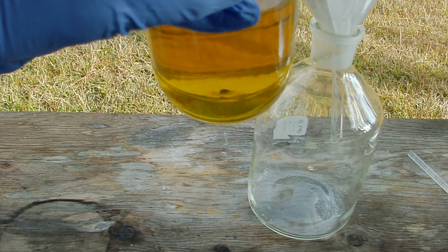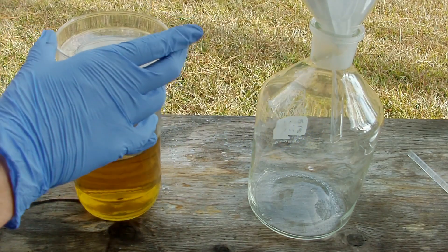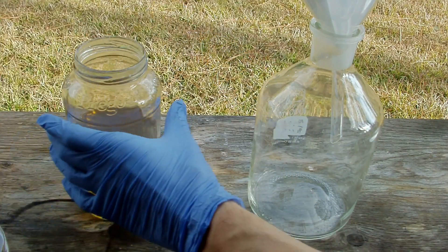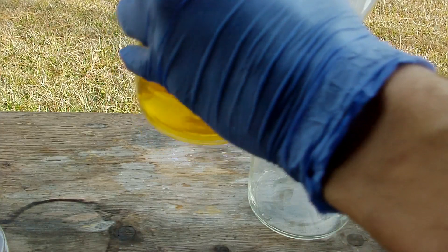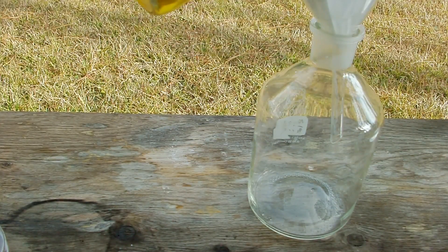You might be able to see on the bottom of the mason jar there's some black dust collected. That's bits of the carbon electrodes that have spalled off during the electrolysis, and that usually happens. The good thing about carbon is that it's not reactive with anything, but they do tend to fall apart. I'm actually very impressed with my electrodes because after 26 hours of running there's hardly any carbon particles left over. I'm still going to filter those carbon particles off into another jar using some standard filter paper.